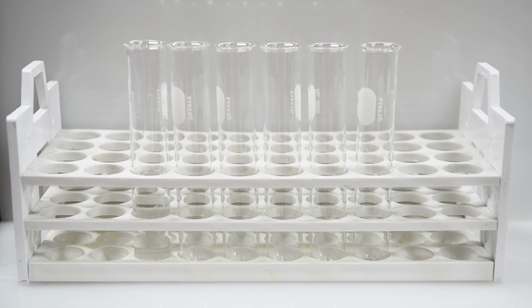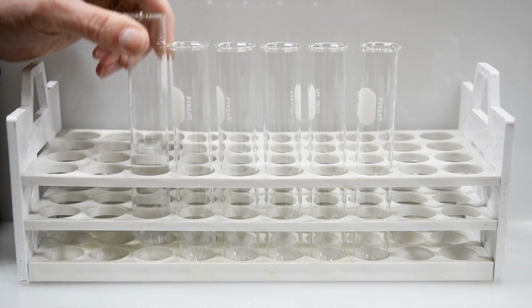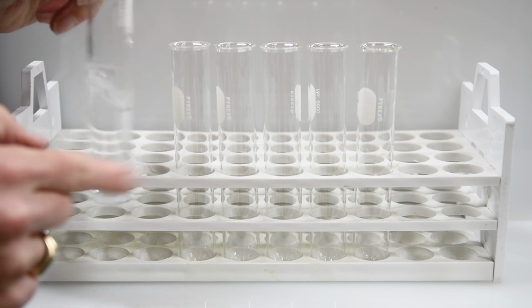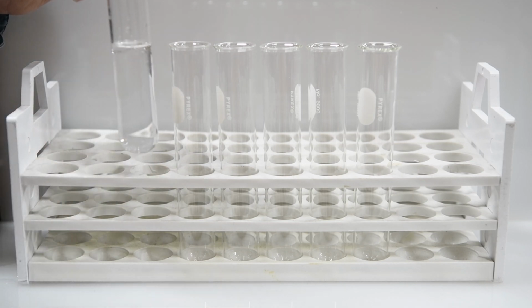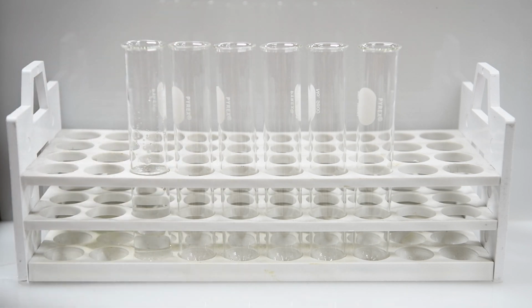Now to make the colors more brilliant, we're going to add a layer of hexane to the top of the water layer. I'll pull the test tube out so you can see there's that little layer of hexane on the top. I'm going to mix that around, and any chlorine that's in the test tube should rise to the top. And since chlorine is fairly colorless, you can see that top layer has very little color to it.